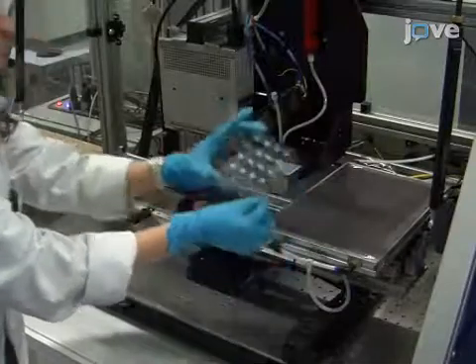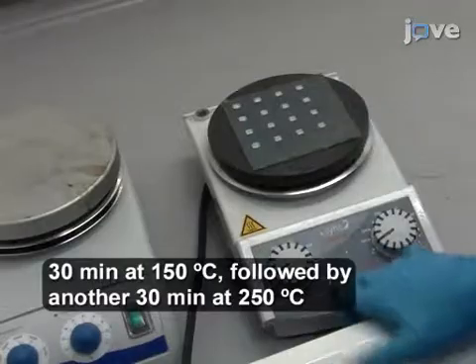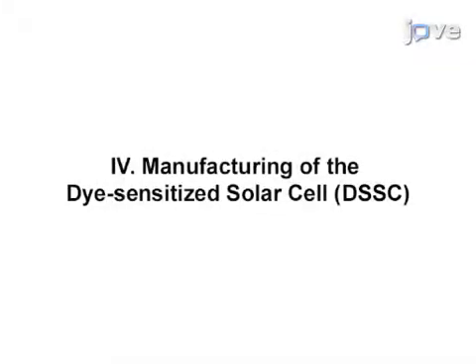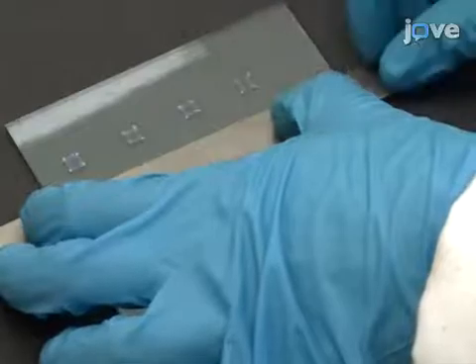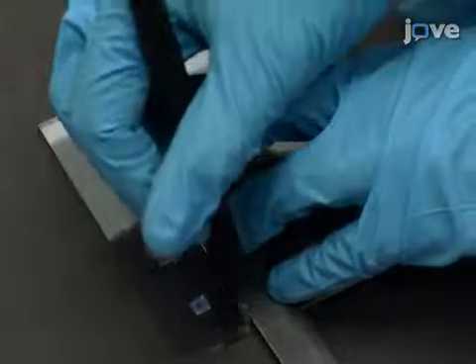To complete the process, remove the substrate and heat the printed film on a hot plate. Using a diamond glass cutter, cut around the printed area to produce a smaller piece approximately 20 millimeters square.